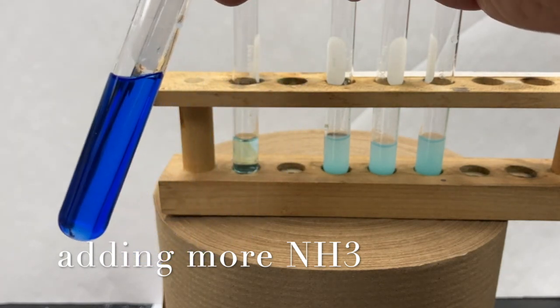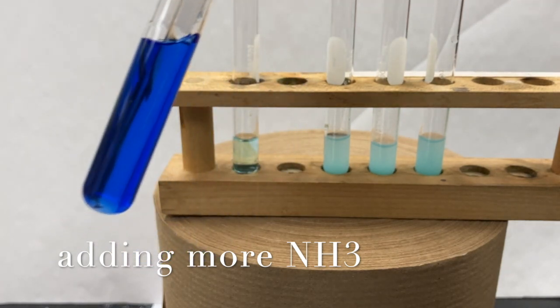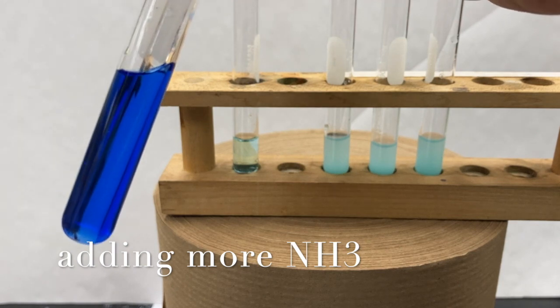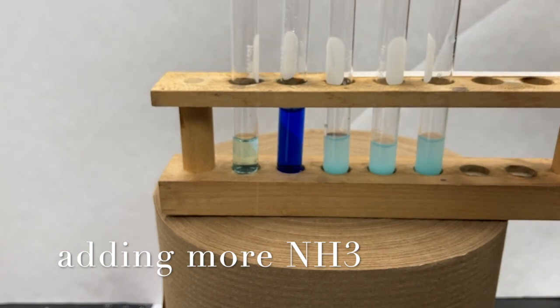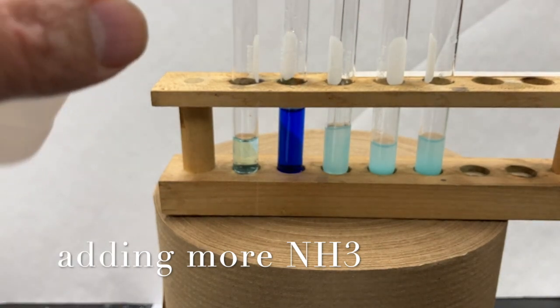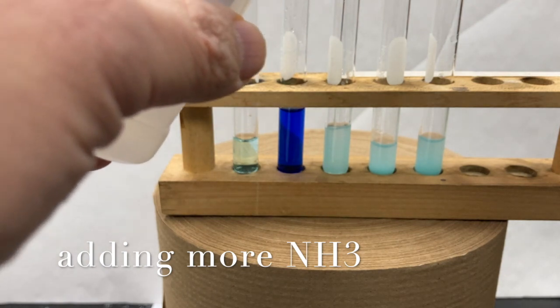Now, if we keep adding ammonia, we get this very vibrant, deep blue. So let's go ahead and repeat that for the rest of the tubes.